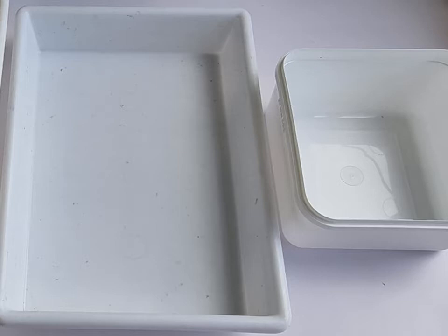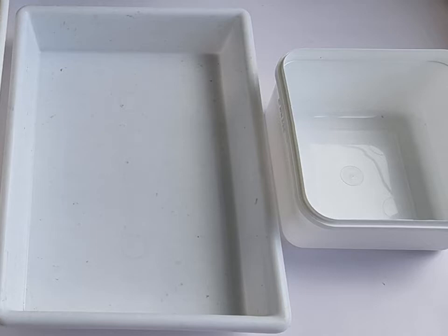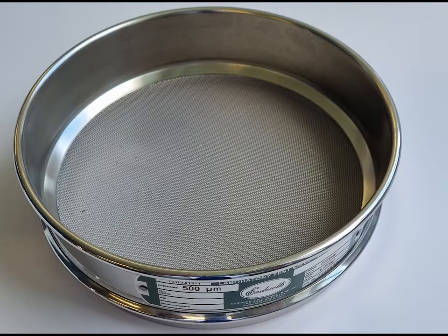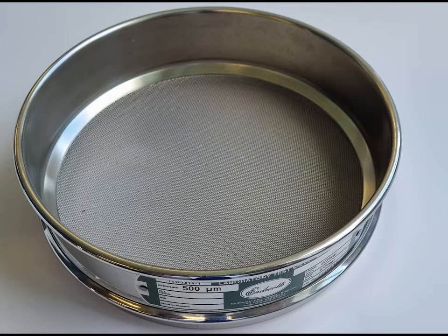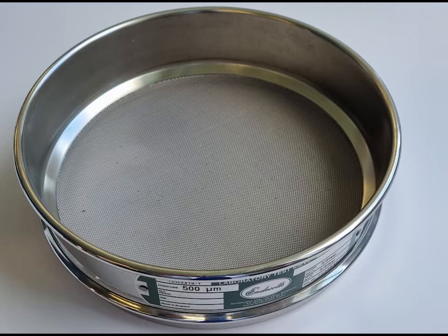When you start doing that you need some trays — you can have an expensive tray on the left or an ice cream container on the right, for example — and you're probably going to need to sieve your sample, especially if it's full of lots of mud and silt. You can see here I've got a 500 micron, or half a millimeter, sieve, which we use to sieve macro-benthic invertebrates.